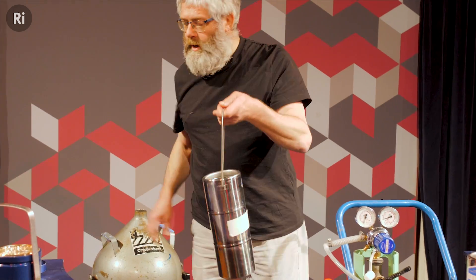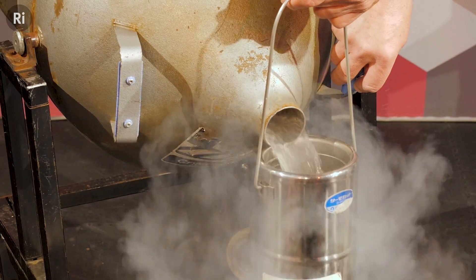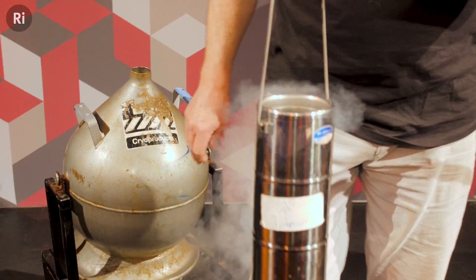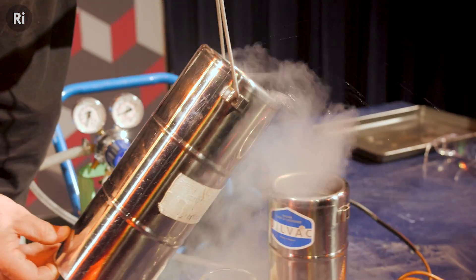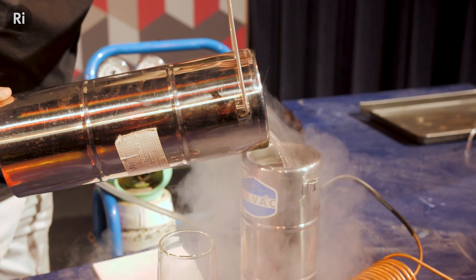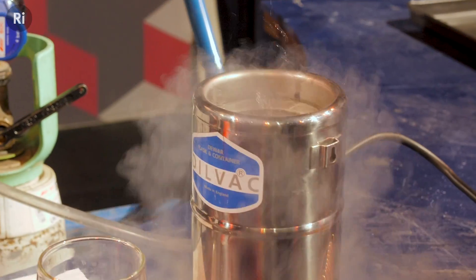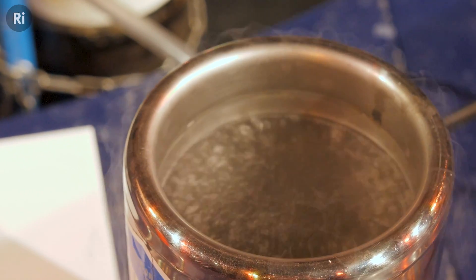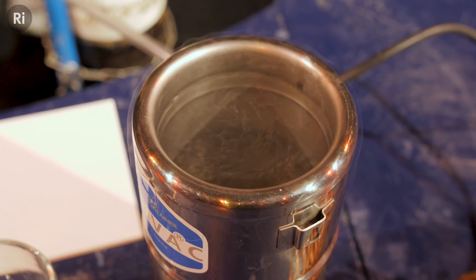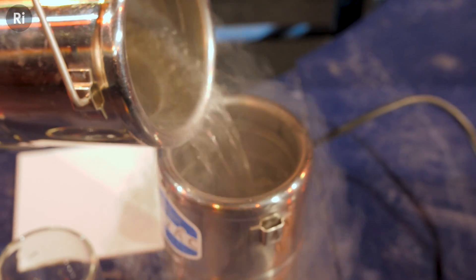What we do have is some liquid nitrogen, and I've got that in this large dewar here. I'm just going to decant some into this smaller dewar and then pour some of that into this even smaller dewar. Liquid nitrogen boils at minus 196 degrees centigrade. You can see it's boiling at the top of the flask there due to the heat of the dewar. The dewar is a double-walled vessel with a vacuum between the two walls, which means it can keep the liquid nitrogen nice and cold.